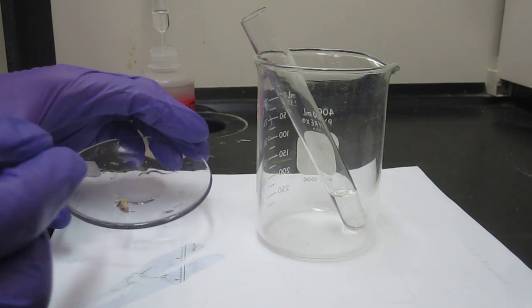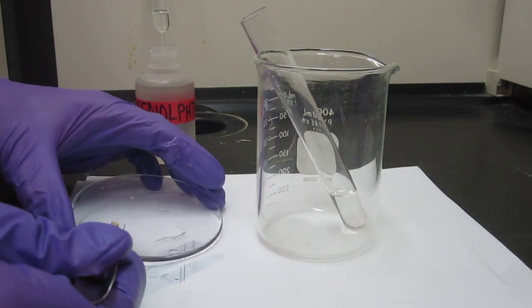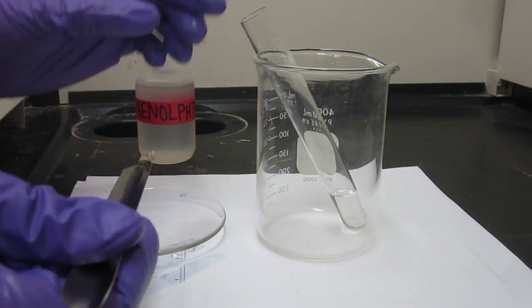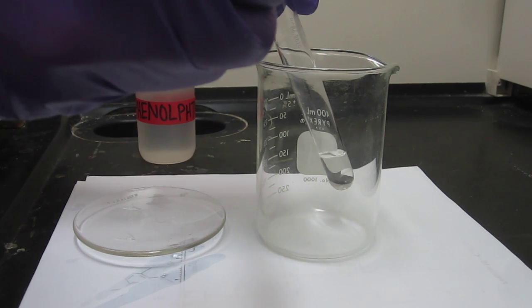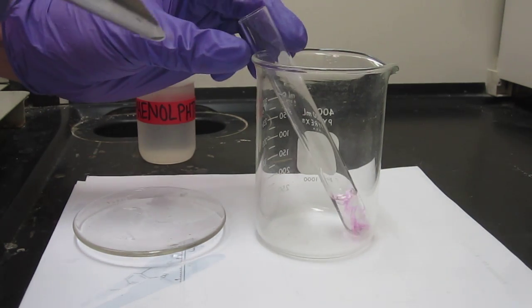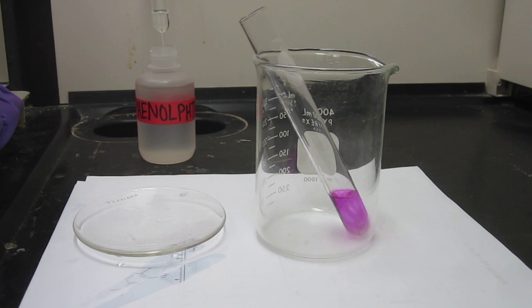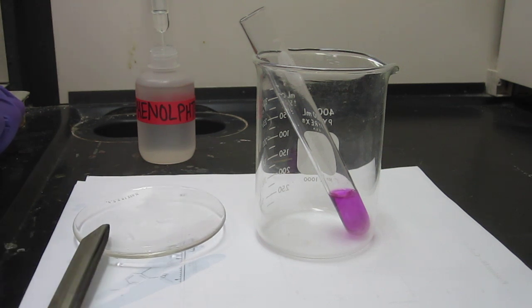And now we've got a little tiny piece of sodium here. We're going to put that into the test tube. So is that reacting faster or slower than it reacted with water? Slower. Slower, right? So what does that tell us about the acidity? It's less acidic. Yeah, this is less acidic.